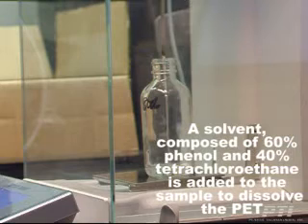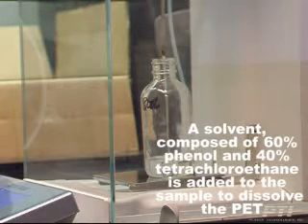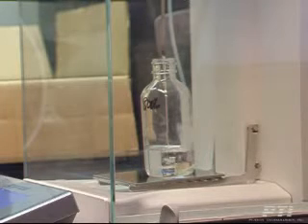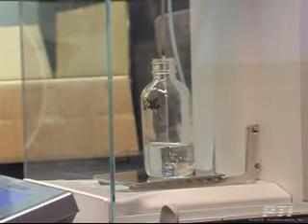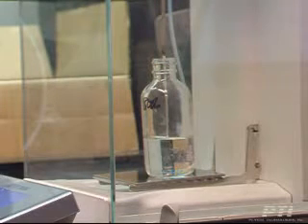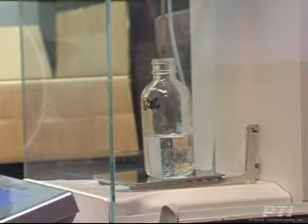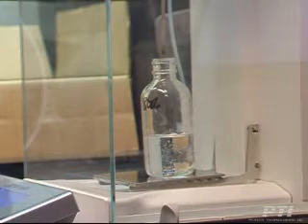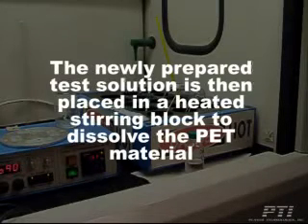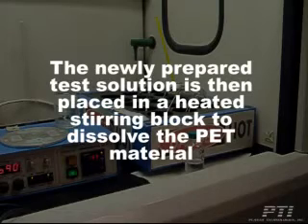A solvent composed of 60% phenol and 40% tetrachloroethane is added to the sample to dissolve the PET. The newly prepared test solution is then placed in a heated stirring block to dissolve the PET material.